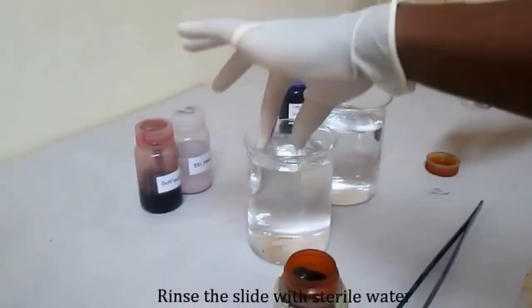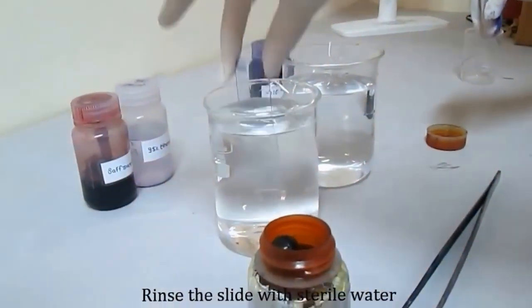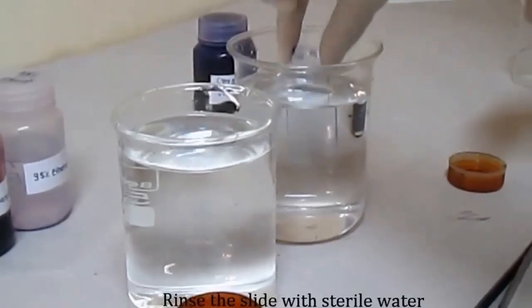After 1 minute, rinse the slide in the sterile water so that most of the dye gets off.